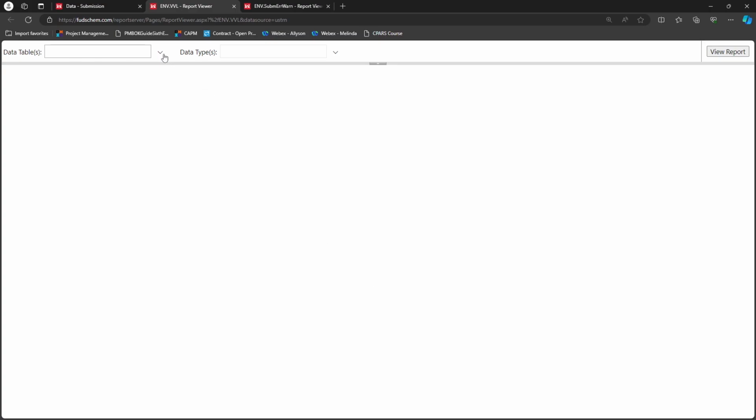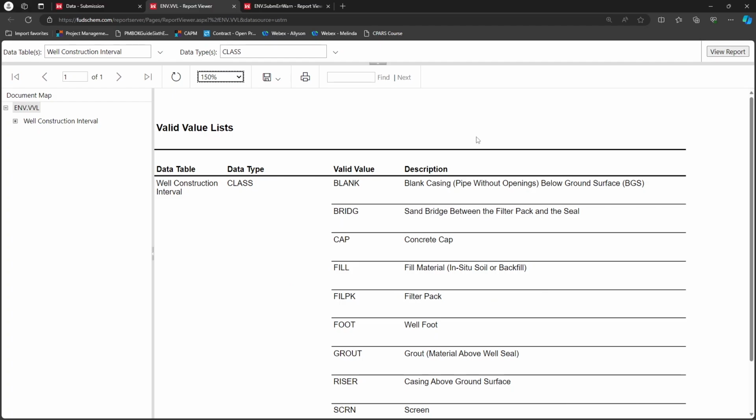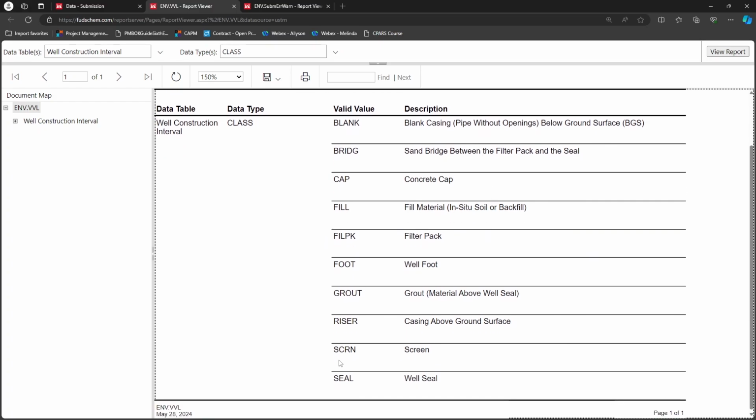Select Well Construction Interval and choose Class. Our file contains the value SCEN to indicate our screen, but we can see the correct valid value for the screen is SCRN.